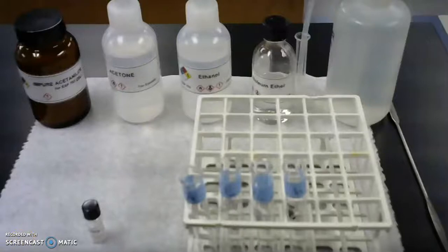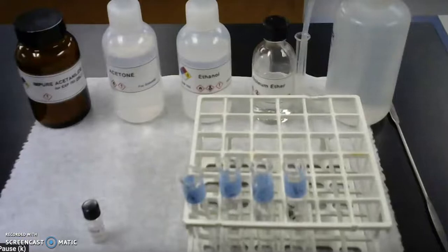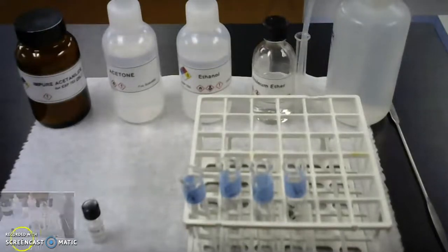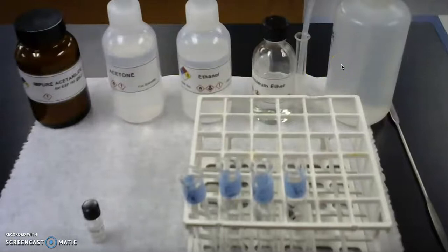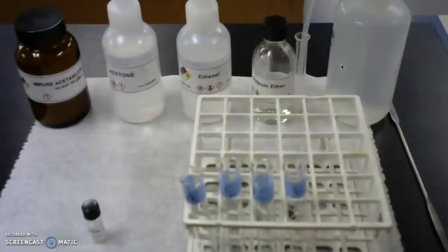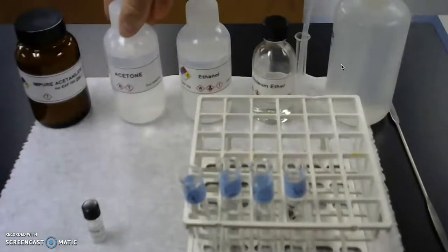We're going to try today to determine the best recrystallization solvent for acetanilide, and we're going to do that using acetone, ethanol, petroleum ether, and water. Hopefully one of them will be the appropriate recrystallization solvent for the acetanilide solid that we want to look at.